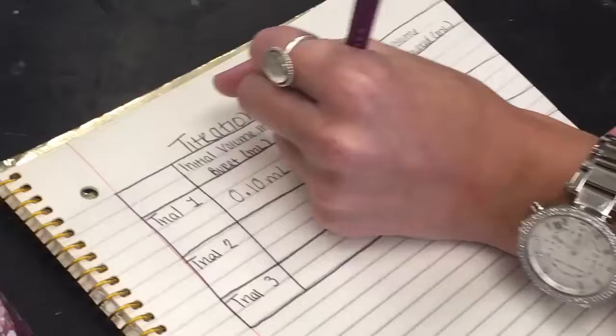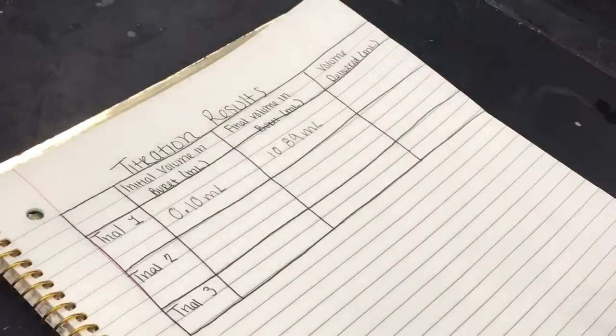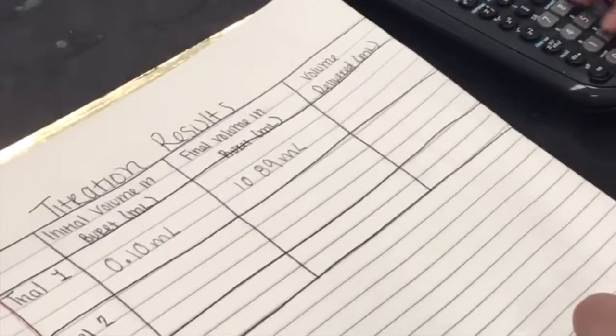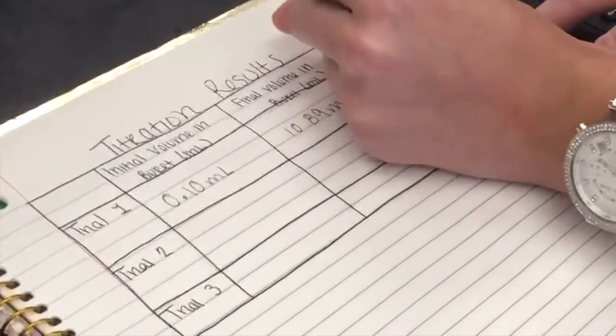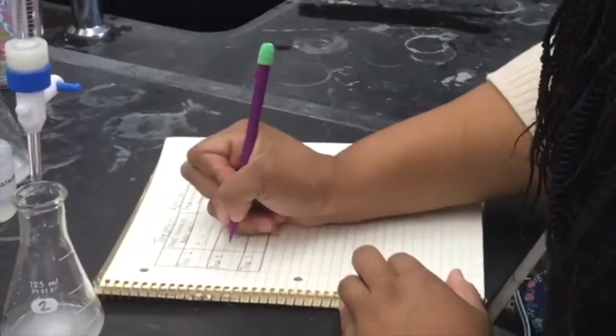The purpose of a titration can be to determine the concentration of a solution. In order to know the final concentration, first you need to take note of the volume before and after the titration process. In addition, you need to know the initial concentration. If it is not given, calculate the concentration by finding the molarity. Molarity is calculated by moles over liters.